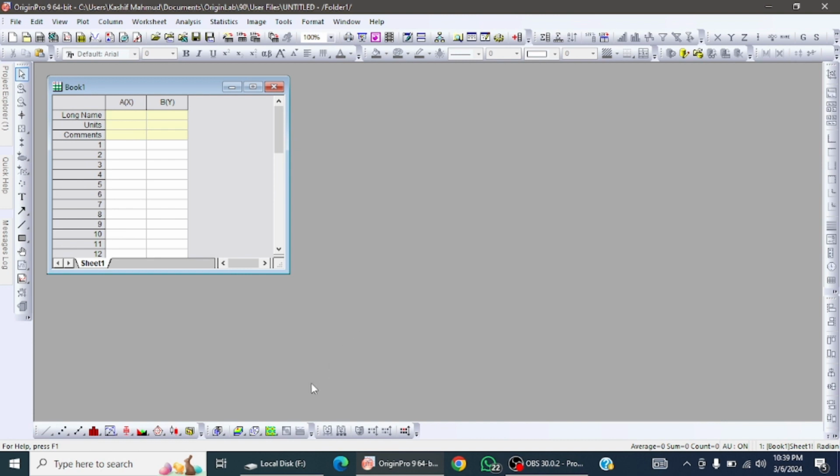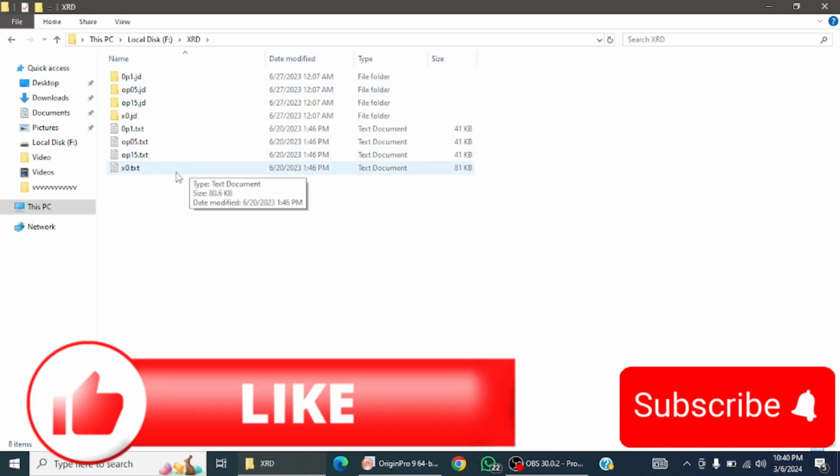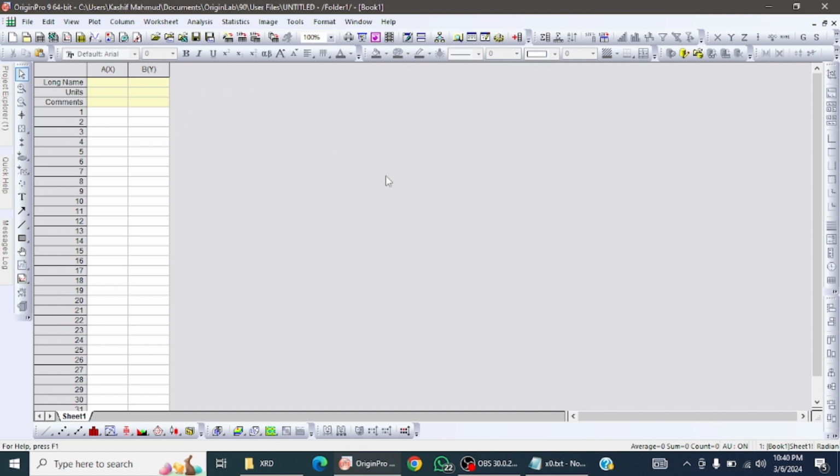So first, go to the file. You will get this type of data from XRD. And when you plot it in Origin, there is a lot of noise in such peaks. So now I'm going to show you how to remove it.